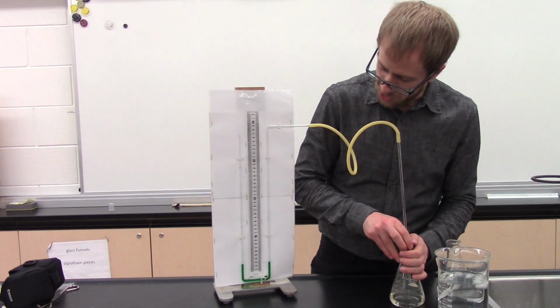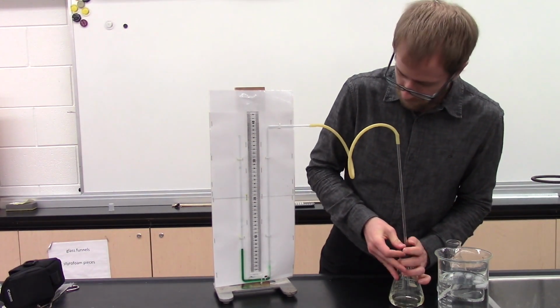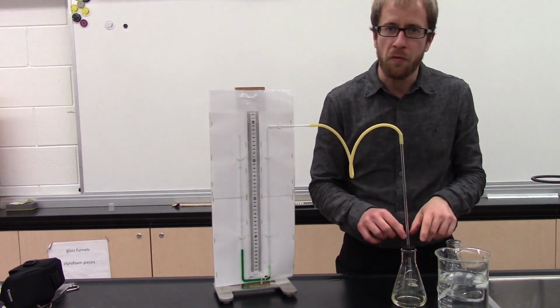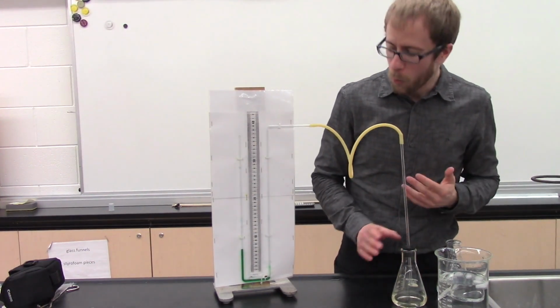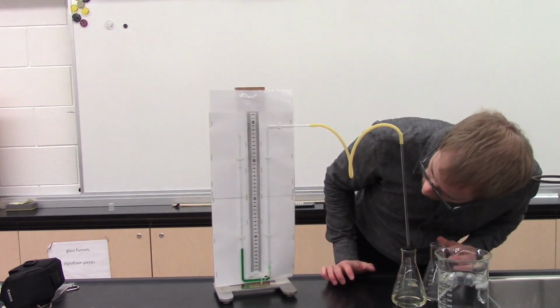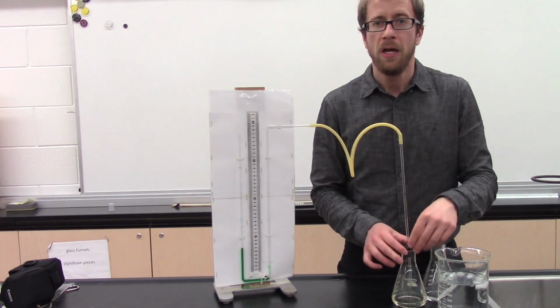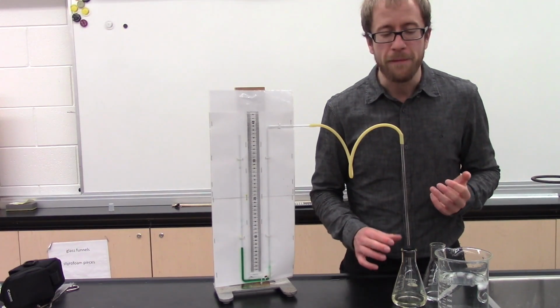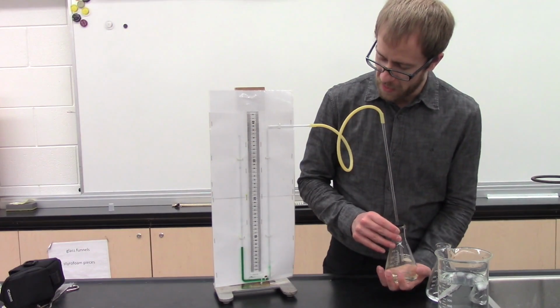Alright, so I hook up the acetone, and now keep in mind the stopper did not go as far into this flask, so our starting point here won't be as high as it was with the water. It is reading out at just above a 7, so this does have a higher vapor pressure, but it is much more volatile. So what do you think is going to happen if I heat this one up with my hands? Well, let's find out.